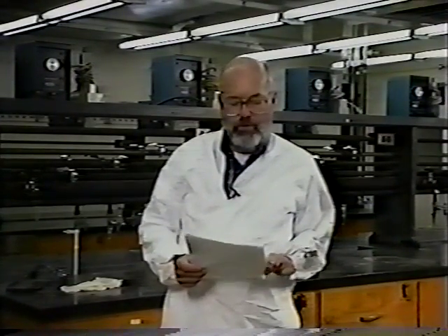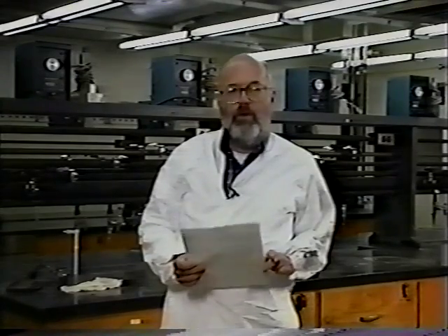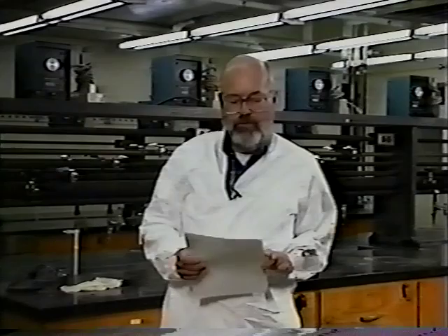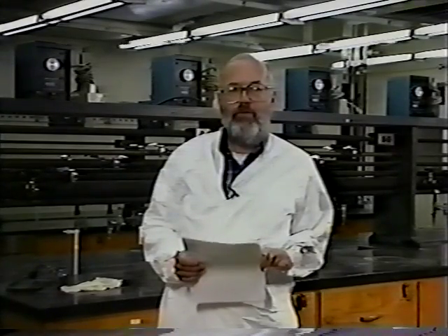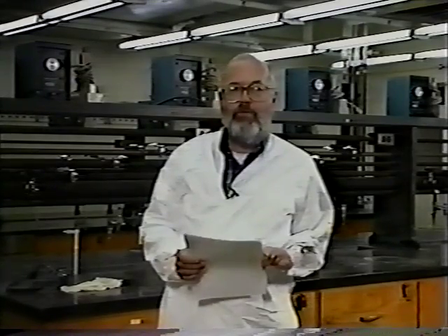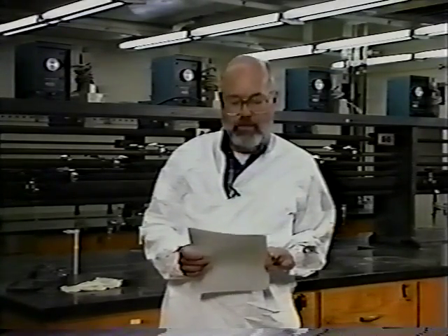Welcome to the organic chemistry laboratories. Laboratory courses are intended to introduce you to the techniques which are used to make the experimental observations and the measurements from which it is possible to make inferences and deductions about organic chemistry.